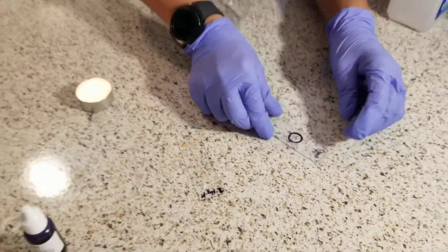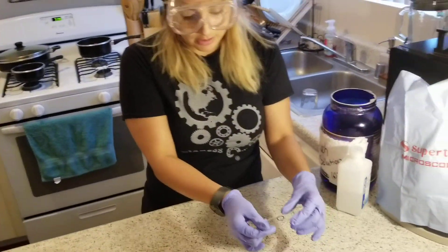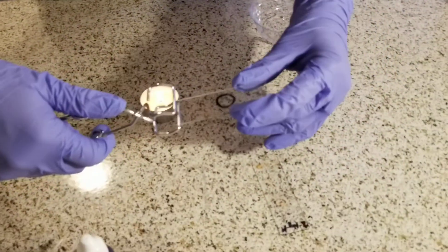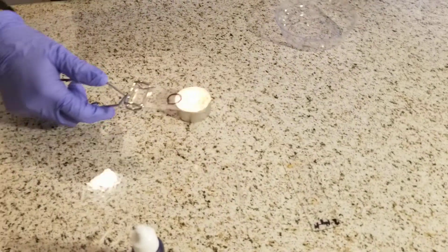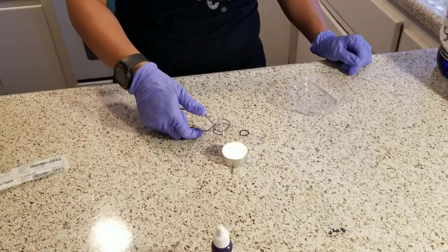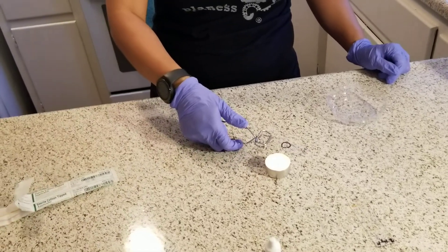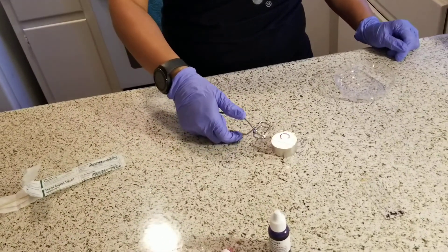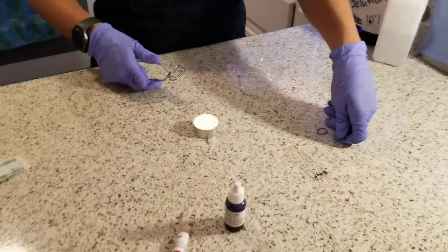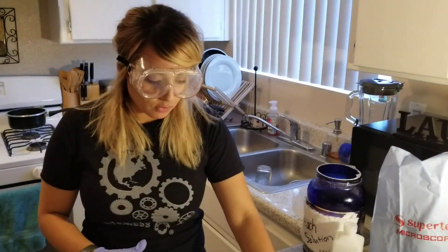Going back to my first slide — the direct stain — I will use my tube clamps and heat fix it. I'm going to take it over the flame five times. This will have the cells stick to the slide. Then I will let it cool for about 10 minutes.